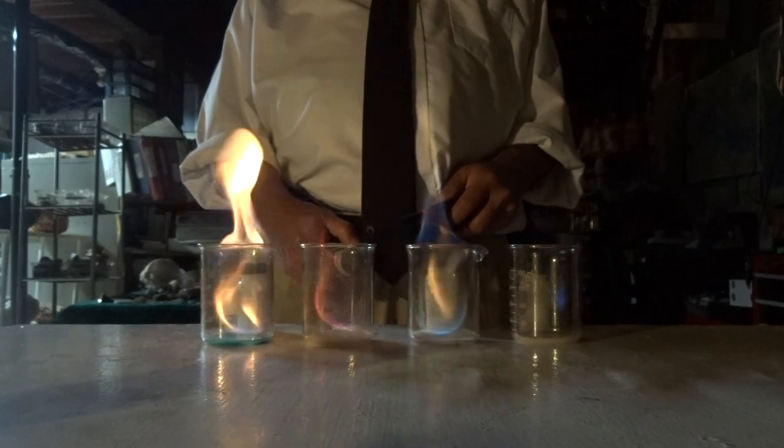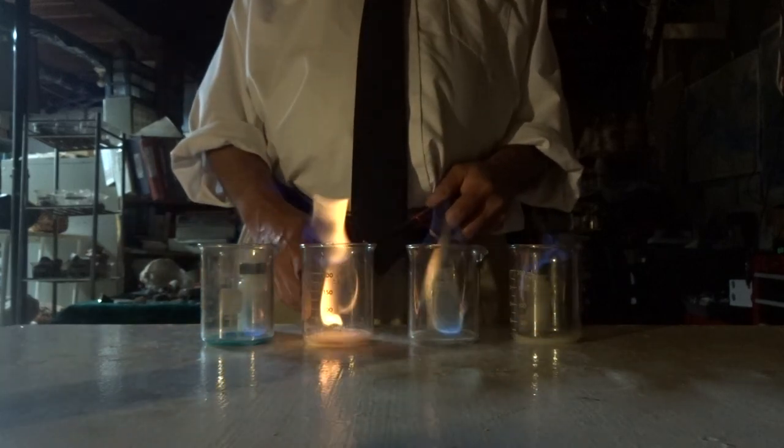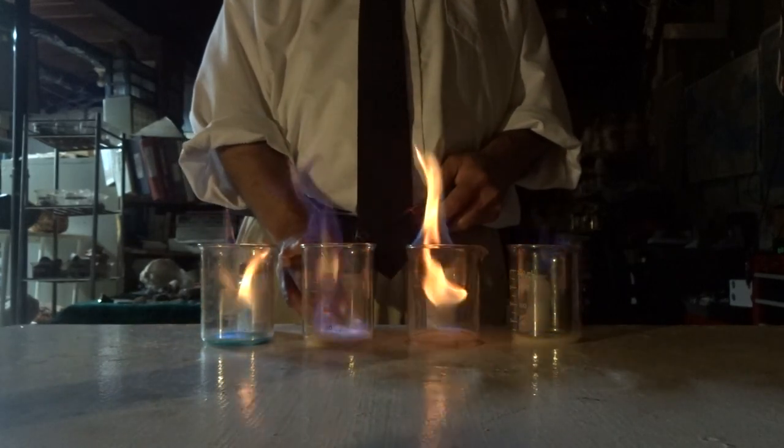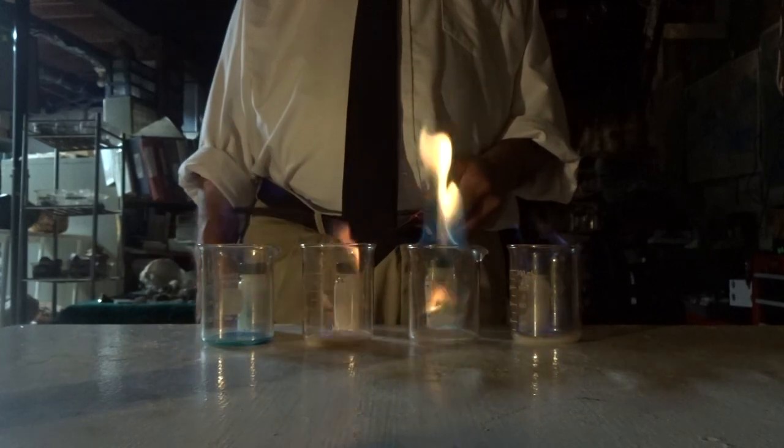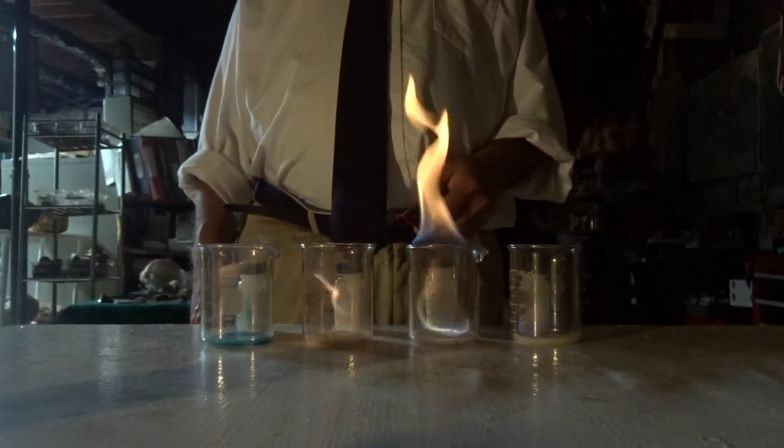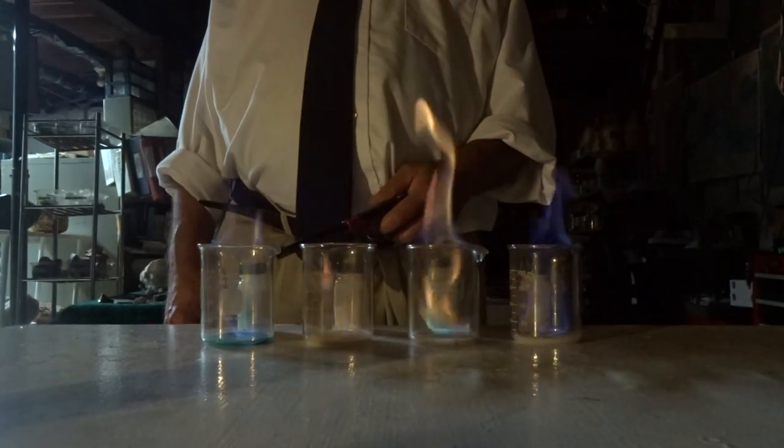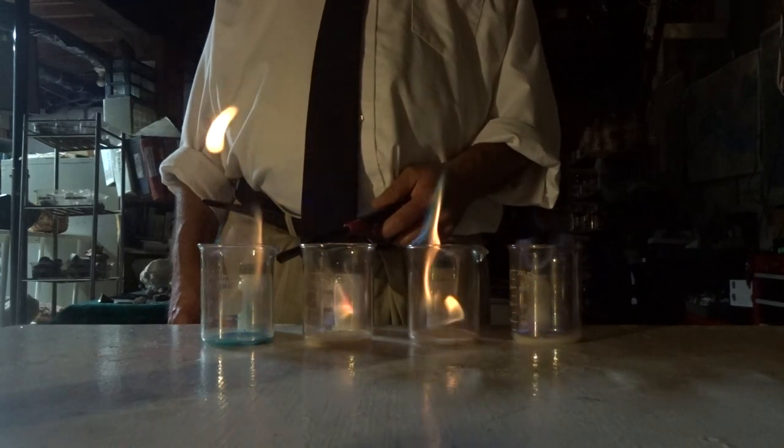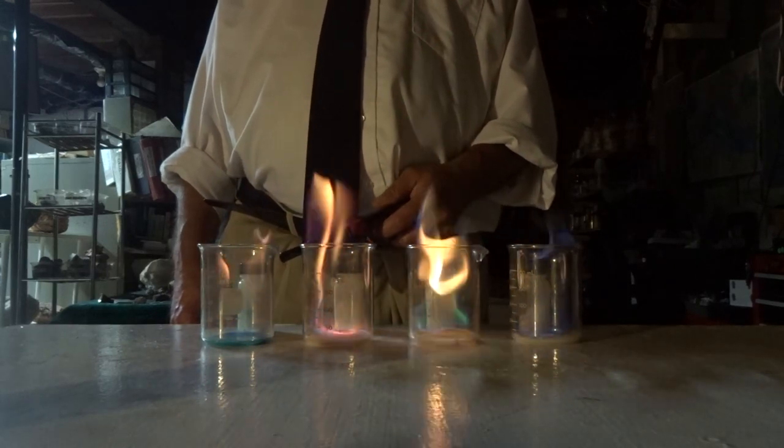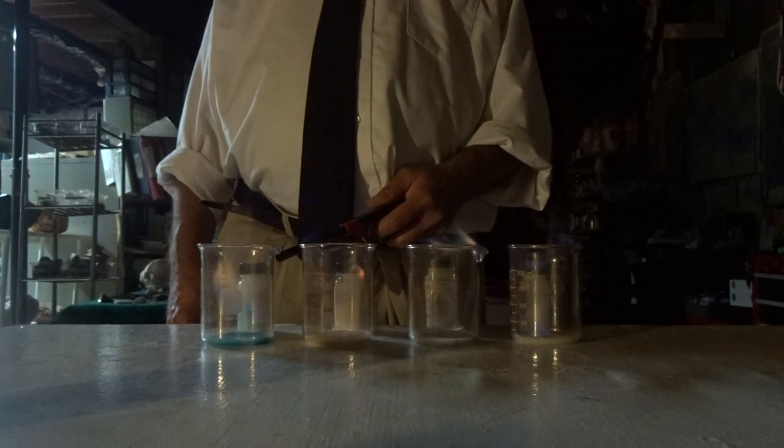The strontium is being the flame red, and I'm not sure of copper yet.